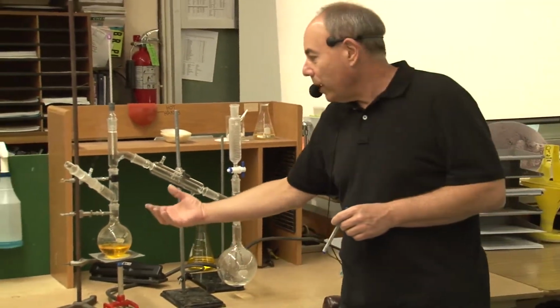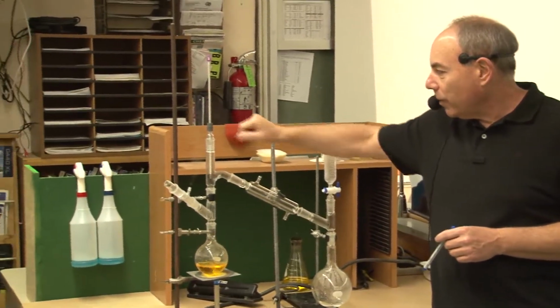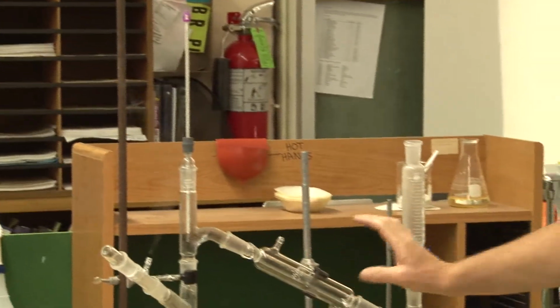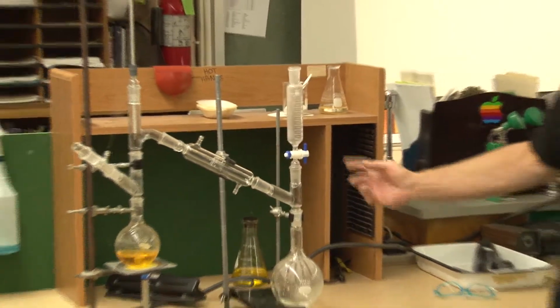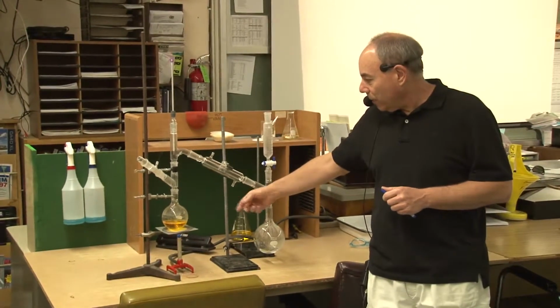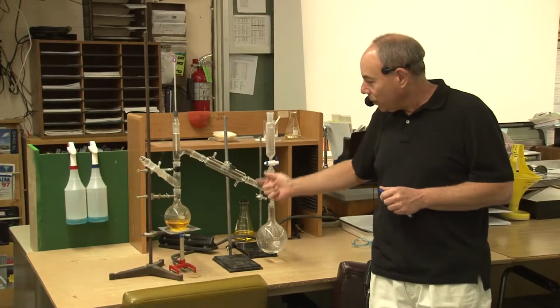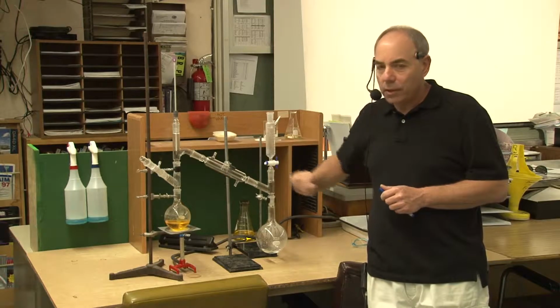So the water vaporizes up into this portion of the tube, it hits the thermometer head, showing about 101 Celsius, and then it moves into this portion of the tube. Now I don't have water available on this table, but normally a water input would be put into this area here, which circulates around an inner tube, cooling it off, and that's the water exit tube right there.